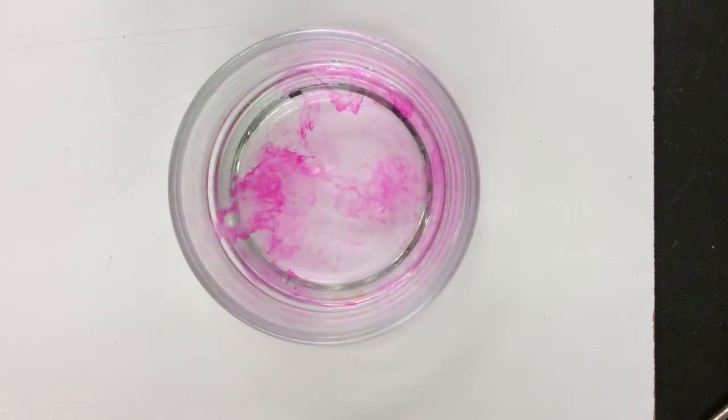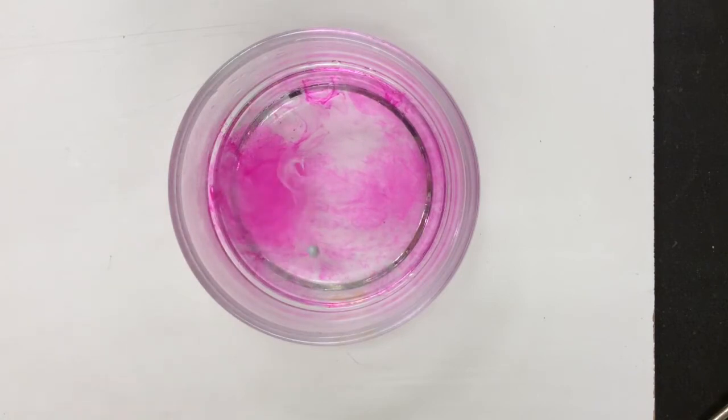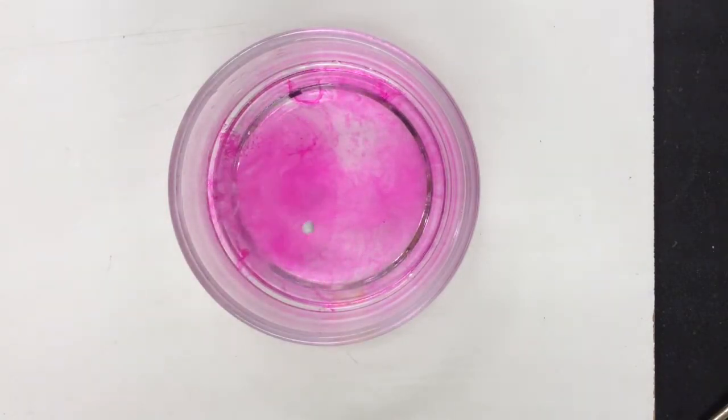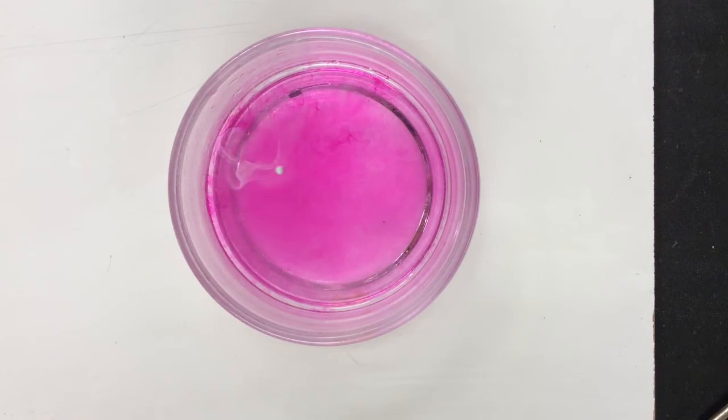Please note as the sodium is reacting, it's releasing a gas, which you can kind of see in abundance there. That gas is hydrogen gas. It's also changing the color of the water. Phenolphthalein turns pink in the presence of a base. So what that's indicating to us is that a base is being produced. Sodium turns into sodium plus, and that reacts with the hydroxides from the water, forming sodium hydroxide.